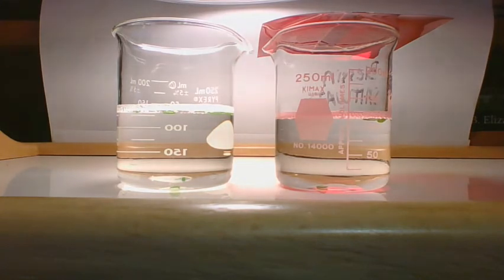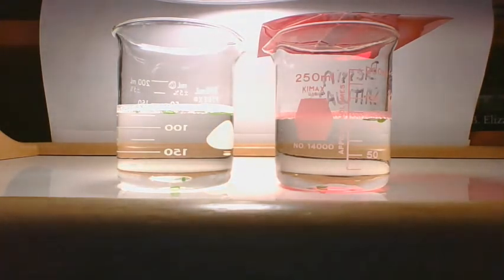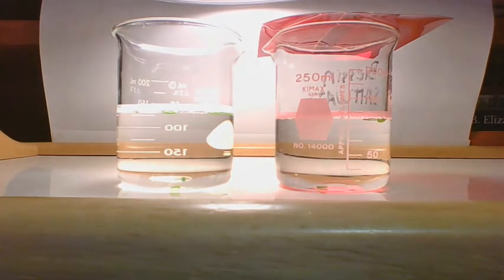At 12 minutes, we still have 8 under the white light and 6 under the red light. If we get to 15 minutes and the last ones are still on the bottom, then we stop.